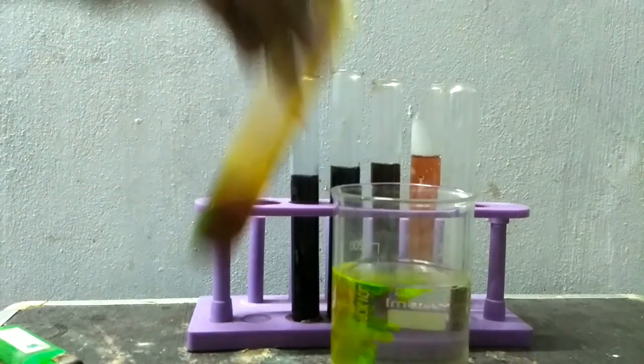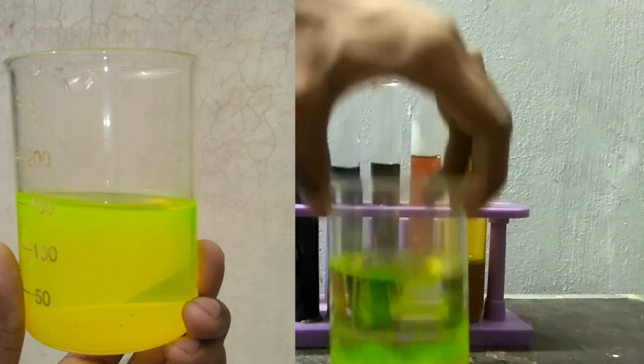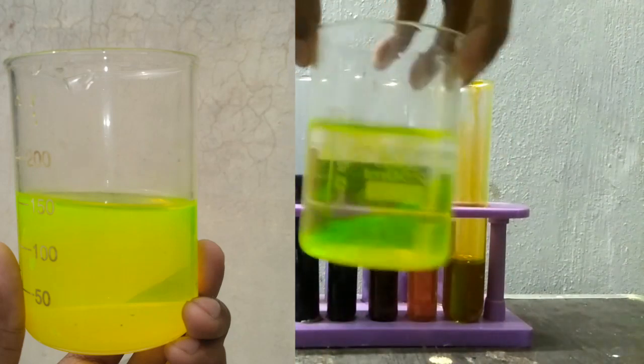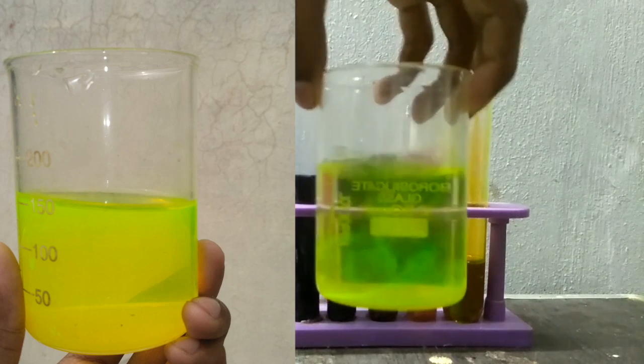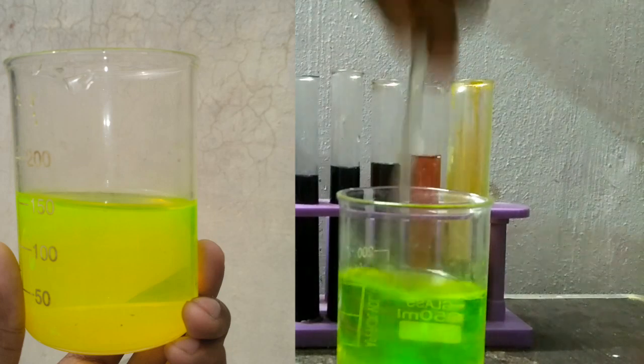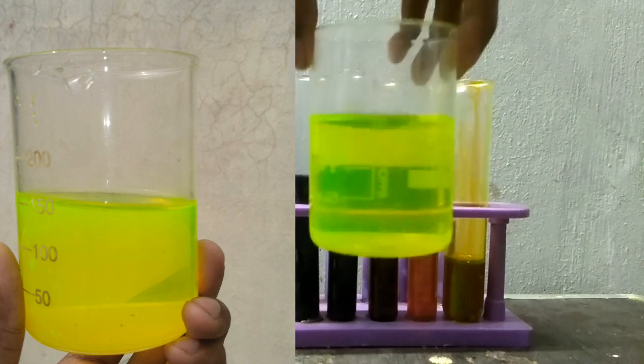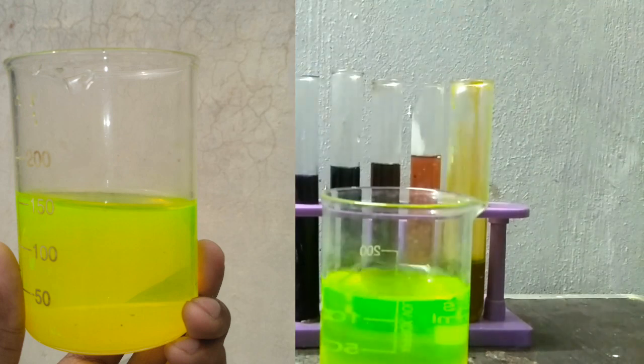You can see that the solution is red with a green fluorescence. Do you observe the red color? And now see the fluorescence - green fluorescence.